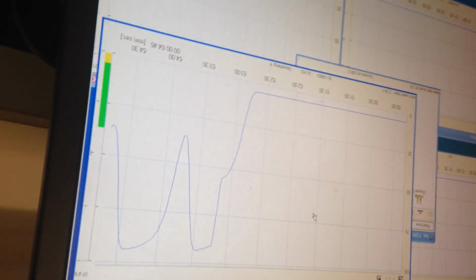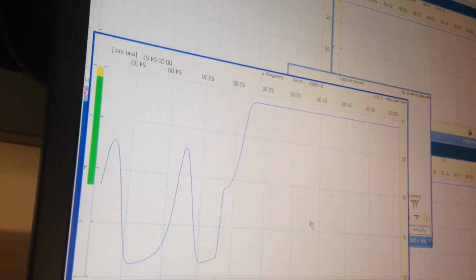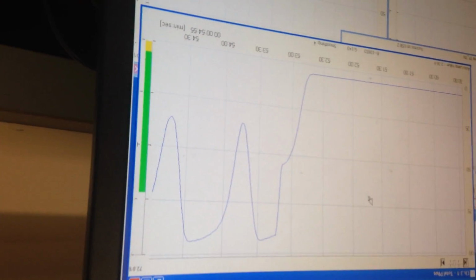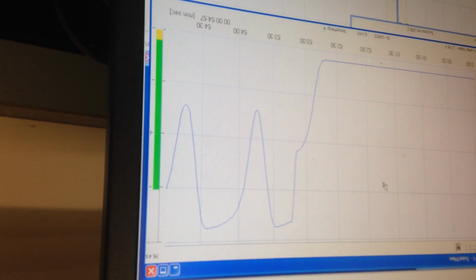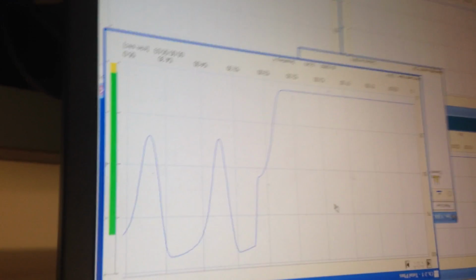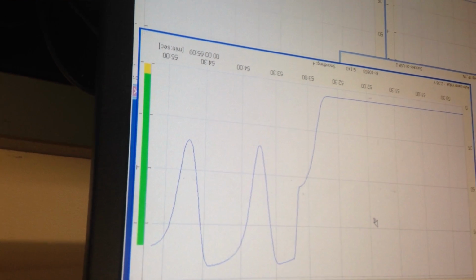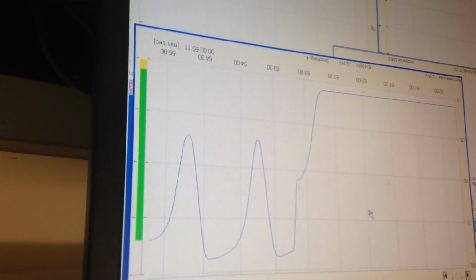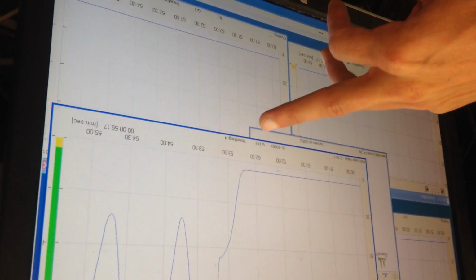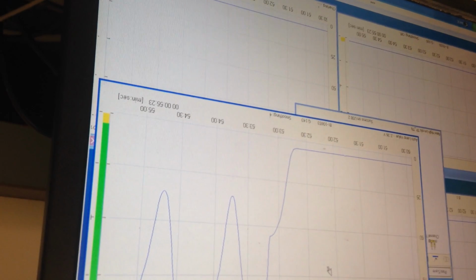calibration spike. And now looking at the third one just to double check, and this is now the 901 cup. Sometimes you have a little bit of difference between the spikes between the two cups. Both the 901 and 910 should be the same concentration because they're the highest. But this one's going to probably top out at like 85%. It's a little bit lower than the 901 cup and the 910 cup, but I think that should be just fine. I don't want to increase that gain anymore because it might send my peaks above 100%.